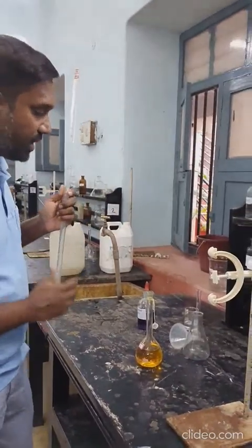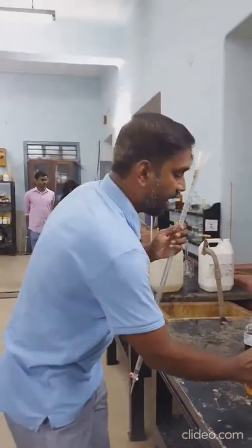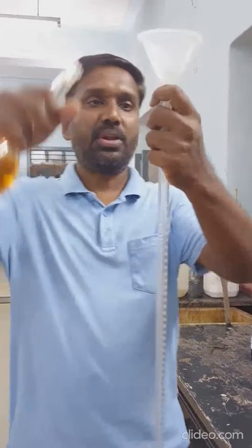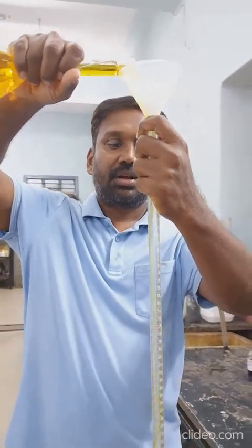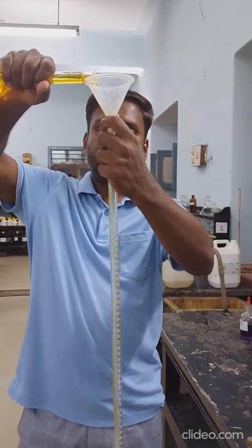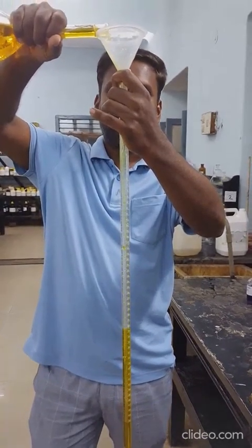Now I will demonstrate the second step of the experiment, which is actually the titration step, for which you have to take potassium dichromate in the burette, ferrous ammonium sulfate (FAS) solution in the conical flask, add the indicator and do the titration. To fill the solution inside the burette, always first place the funnel above it and then start pouring the solution from your standard flask slowly, and try to fill it up to the 0 ml mark.